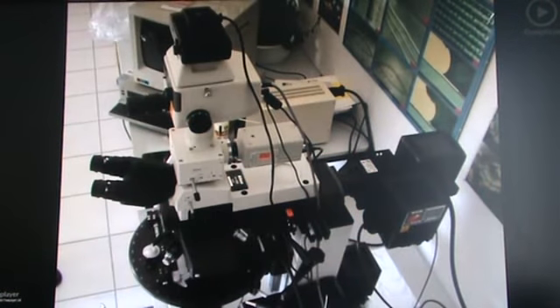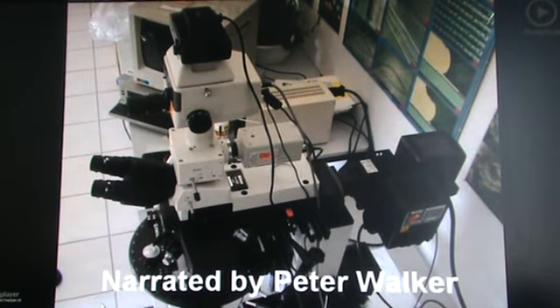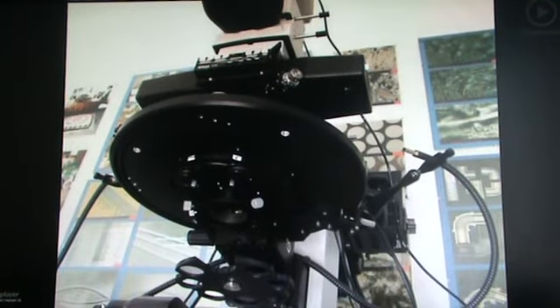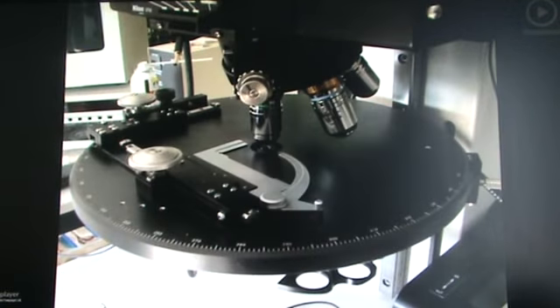In this video, we will be presenting the Ergonome 500, a light optical microscope that is unique and unsurpassed in its high magnification, resolution and depth of field. This short film concentrates on showing specimens taken from the medical world, where direct comparisons have been made between conventional optical microscope methods and the new methods as seen through the new universal microscope Ergonome 500.